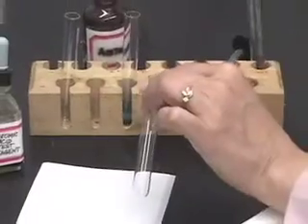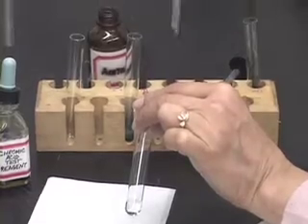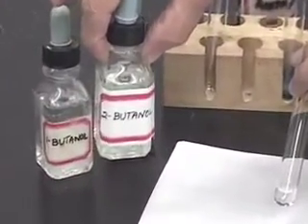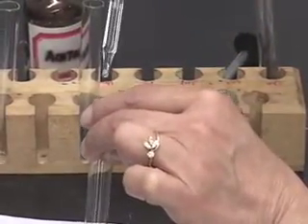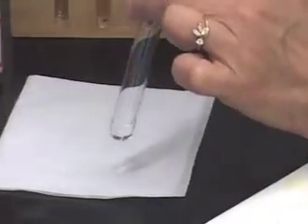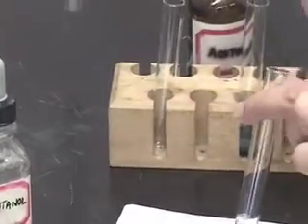Now let us do the test with a secondary alcohol, 2-butanol. We take one milliliter of acetone as before, and to this I am going to add two drops of my test compound, 2-butanol. Mix the two and then we will add two drops of the chromic acid test reagent.